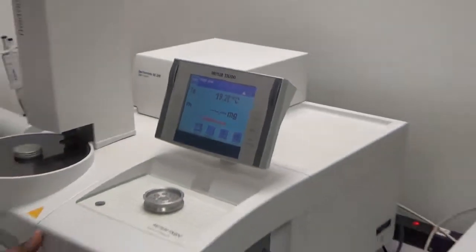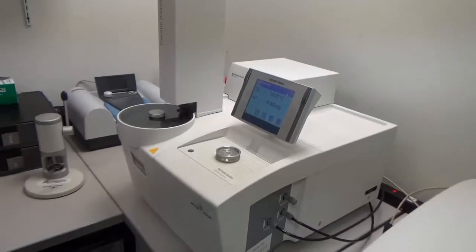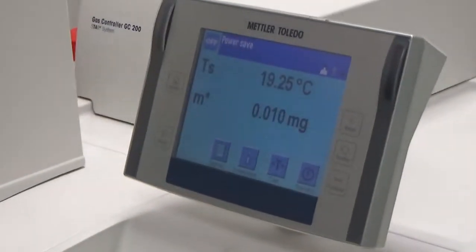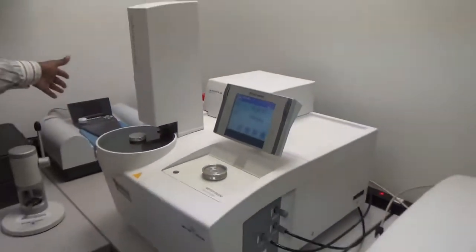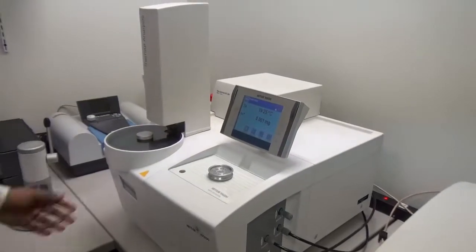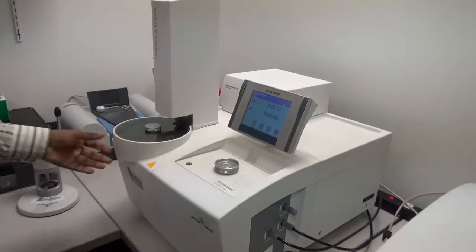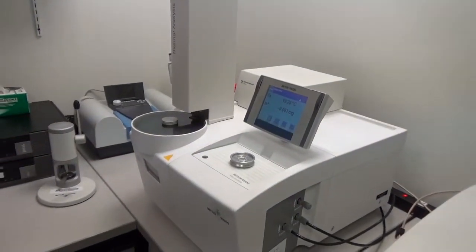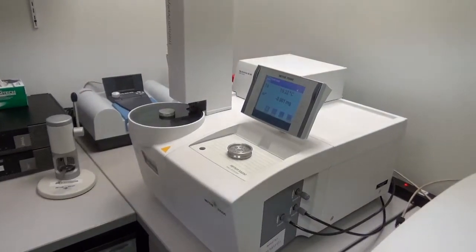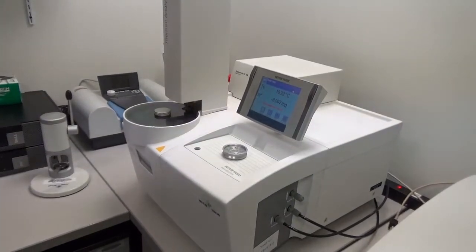This side is the balance and this side is the furnace. This furnace moves back and forth, opens and closes, and the sample goes inside the sensor. There are three types of sensors this machine can take: a simultaneous TGA and DSC sensor, a TGA and DTA sensor, or just the DTA sensor. It's telling 'no communication to host PC' because we haven't started the software.